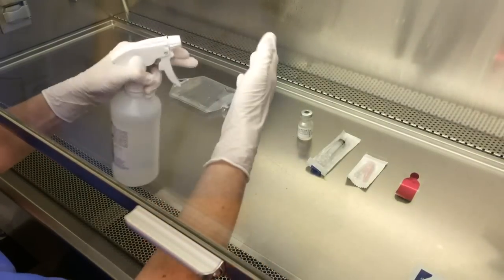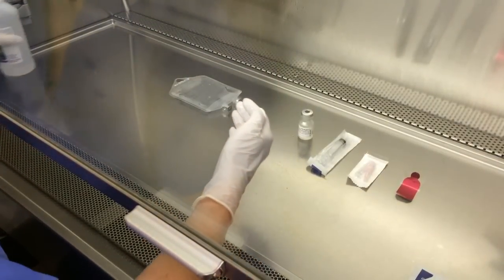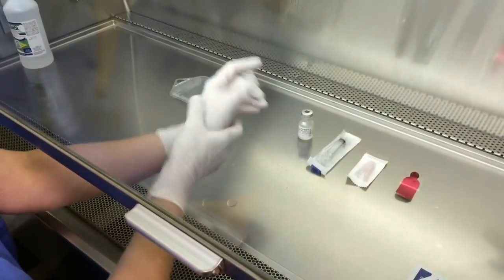Make sure that you spray down your gloves with the alcohol.